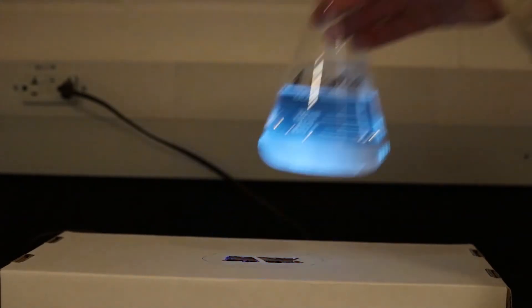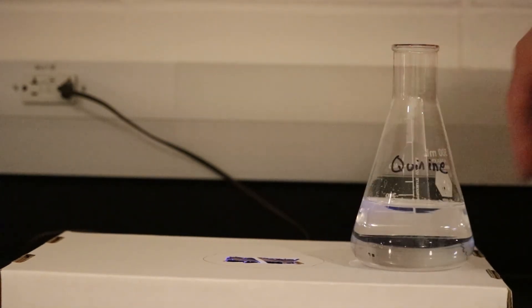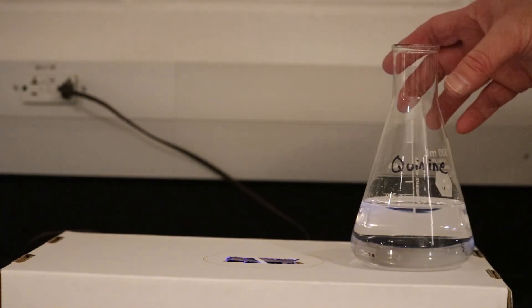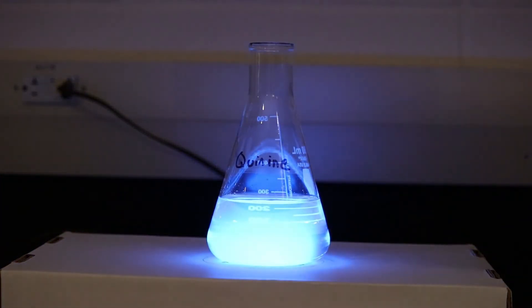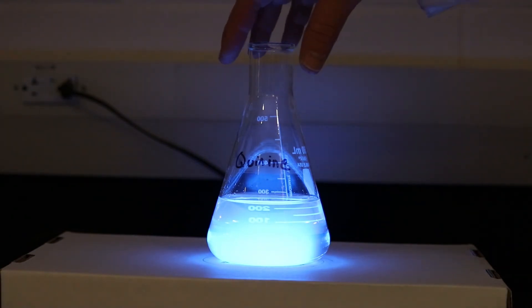And then I have another one that is very similar to that, and that's quinine. Quinine is also clear and colorless when it's dissolved into a very slightly acidic solution. But when we expose it to the ultraviolet light you can see it glows very brightly. We get this nice bright blue color.